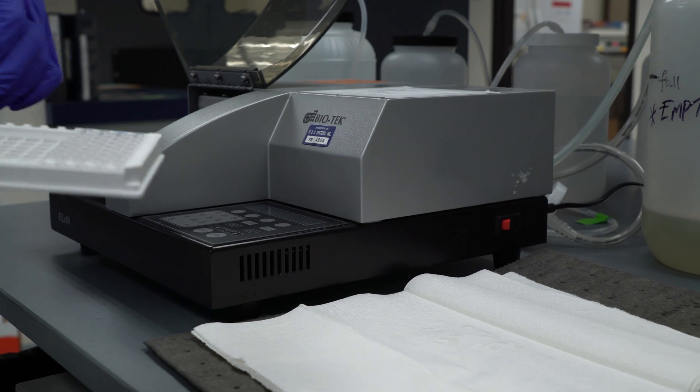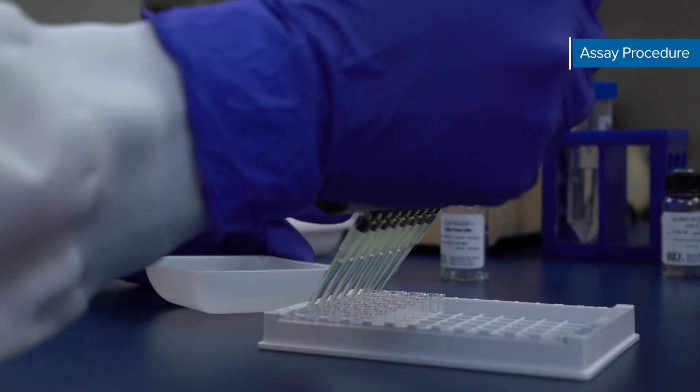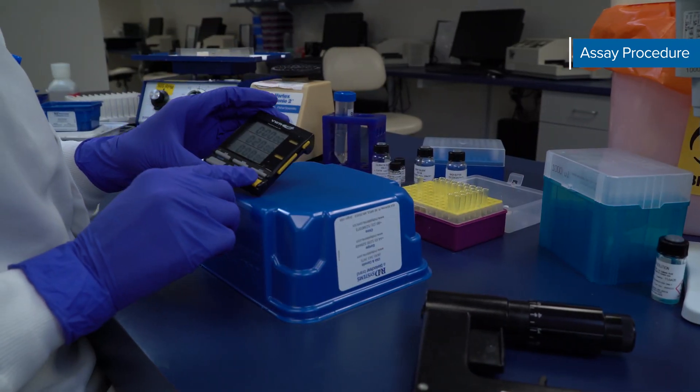Next, add 100 µL of substrate solution to each well. Remember to protect the substrate solution from light. Now incubate for 20 minutes at room temperature on the bench top.